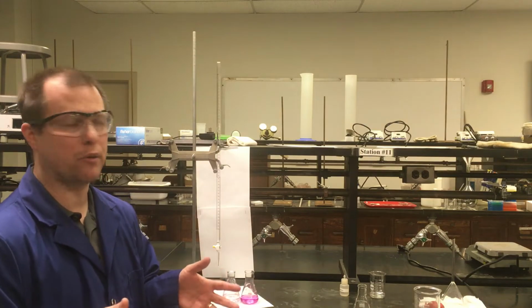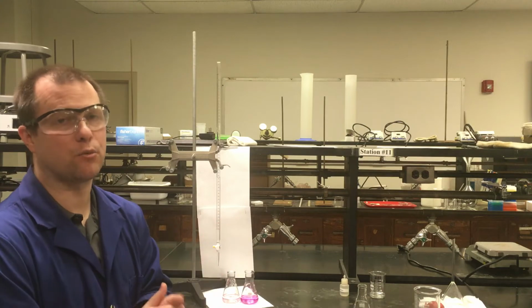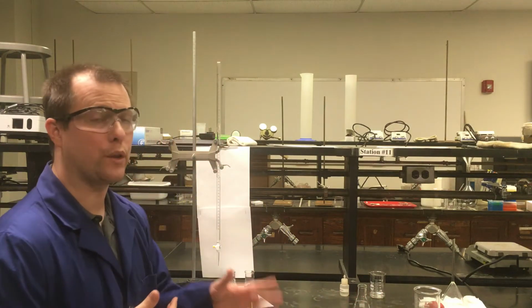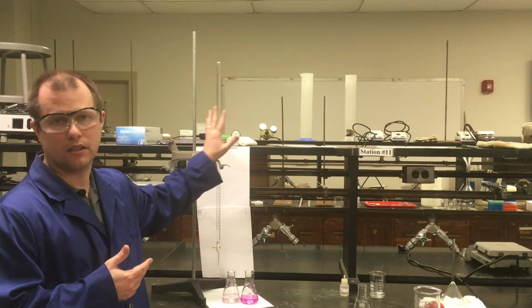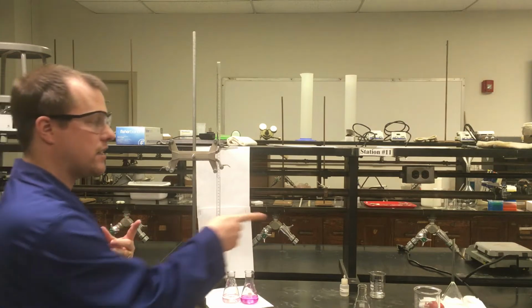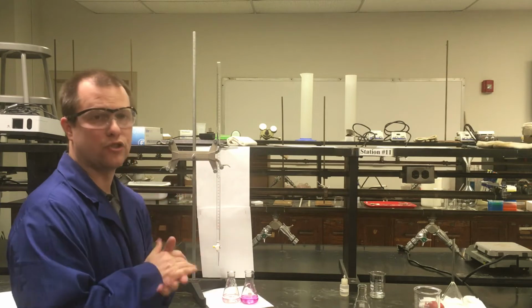And what we're going to end up doing with it is we're going to take that solution and react it with sodium hydroxide. Now, the reason we're going to do that is that we need to find out what the concentration of those ions in here is. Well, one of the ways we can do that is by doing a titration. In particular, we can take advantage of the fact that hydrogen tartrate as an ion is actually still a weak acid. And if we have a weak acid, that means we can react it with a base, which in this case is going to be sodium hydroxide, and that's what's going to be in our burette for the experiment. So by doing this titration, our goal is to find the concentration of the hydrogen tartrate ion, which once we have that, now we can find Ksp. That's the general thought process.